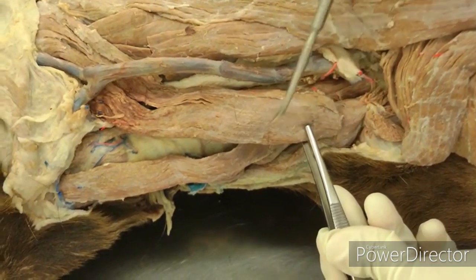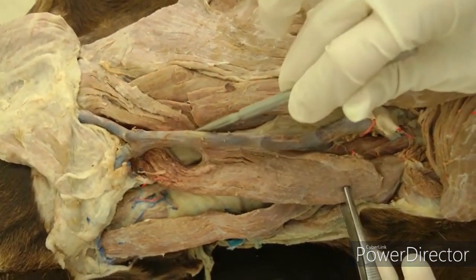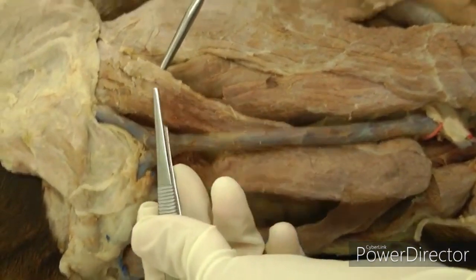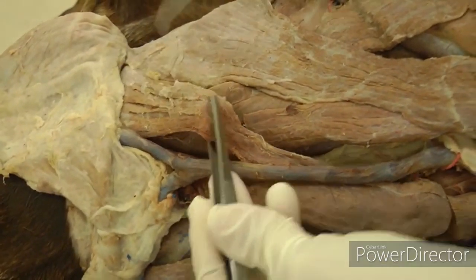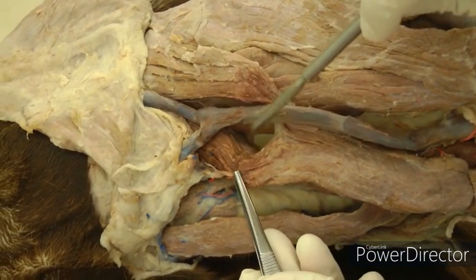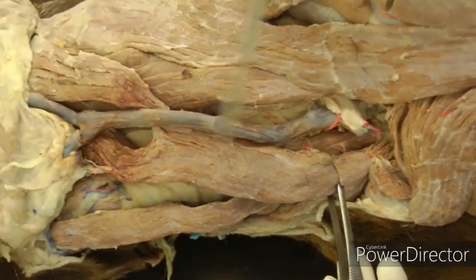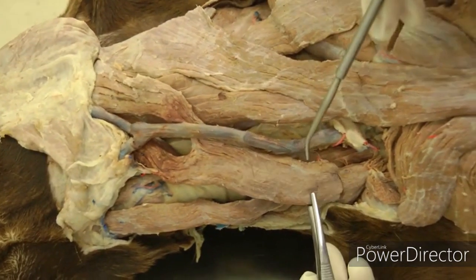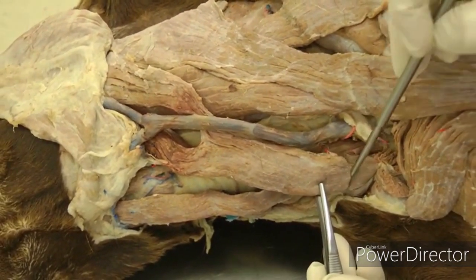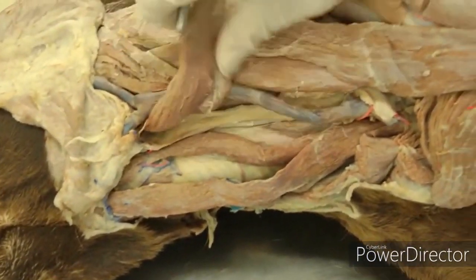Sternocephalicus is a muscle that runs from the sternum to the head and it has two separate parts. They're kind of hard to separate sometimes, but this is the occipital part here, and then the mastoid part is here, kind of underneath that jugular vein. Once you isolate that, you're going to transect sternocephalicus about two centimeters away from the sternum and reflect it up towards the head.